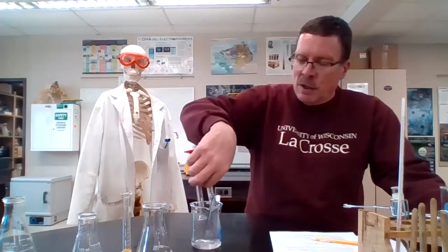I've got it all set up, and this one I don't need the test tubes for because it's at room temperature. Once again, just like yesterday, B is going to go in, and then I'm going to simultaneously put in A and C and hit my timer and then start stirring and wait for it to turn its dark color. So here we go, in we go, dump it out, timer on, and I'm going to stir away.